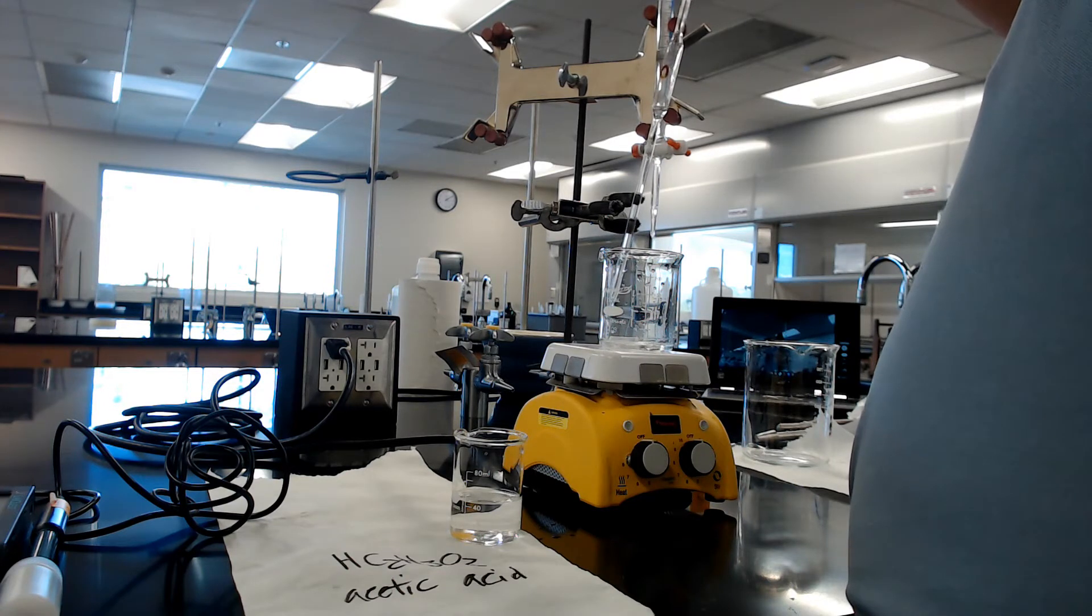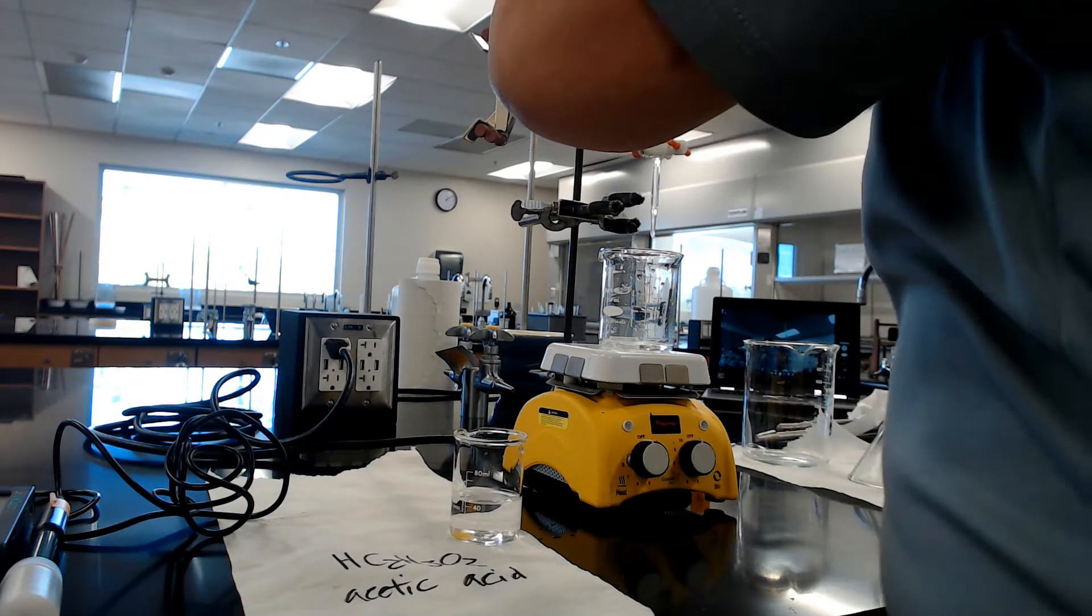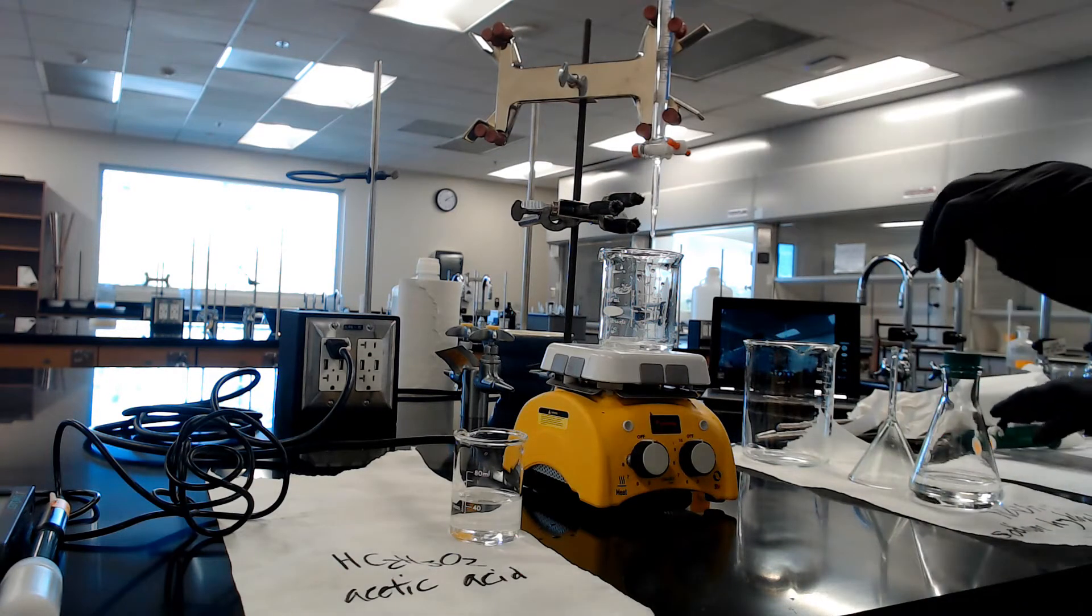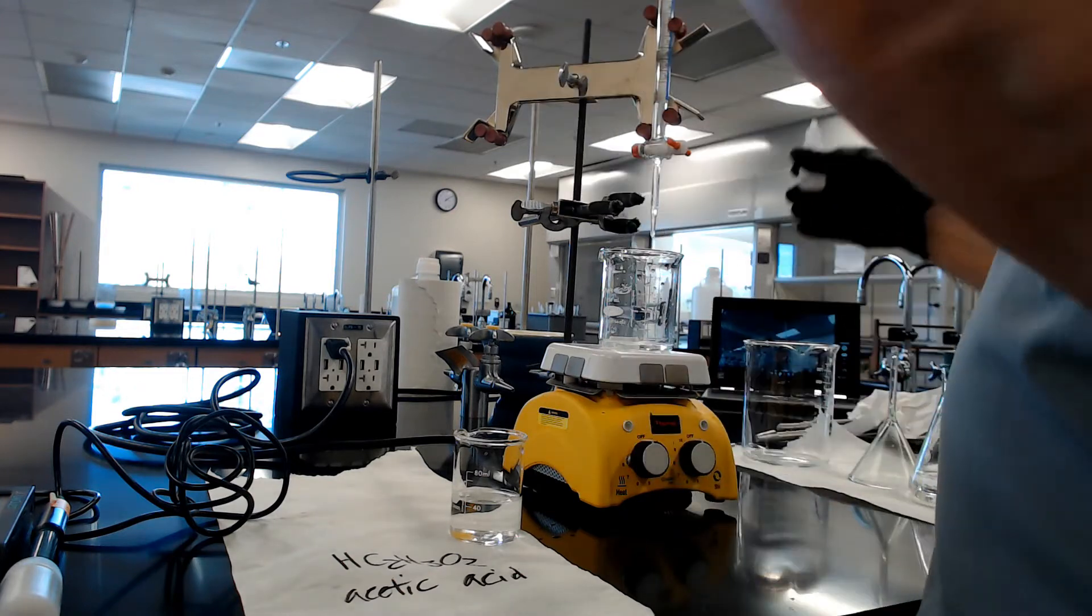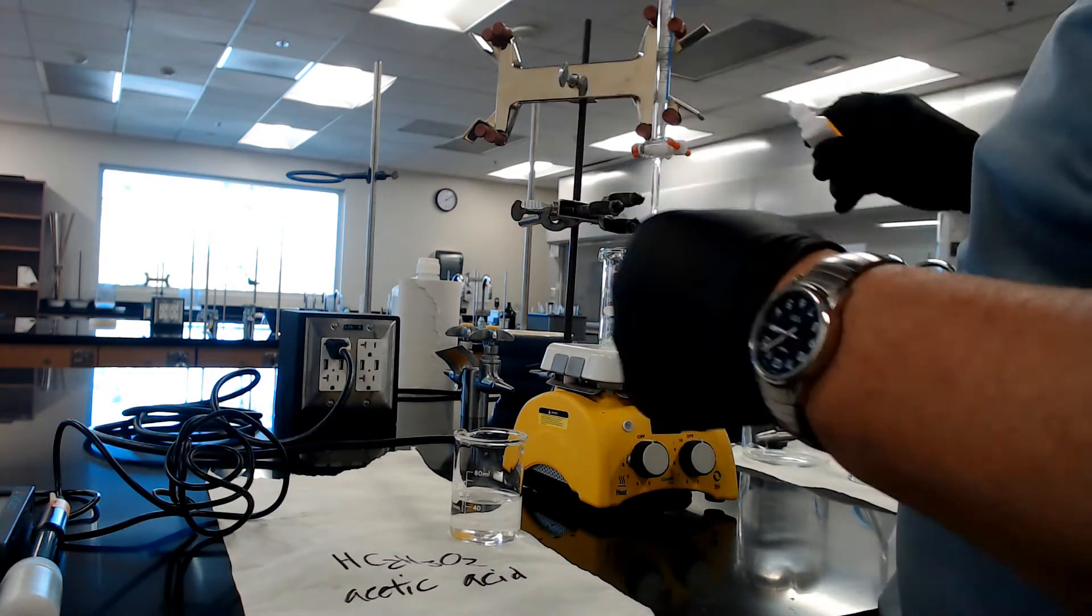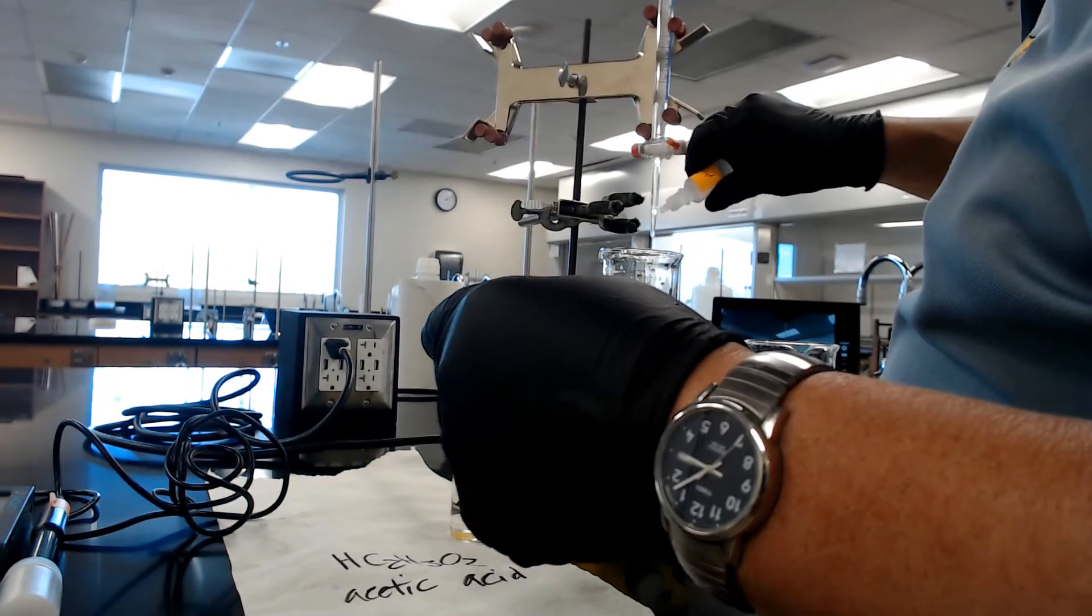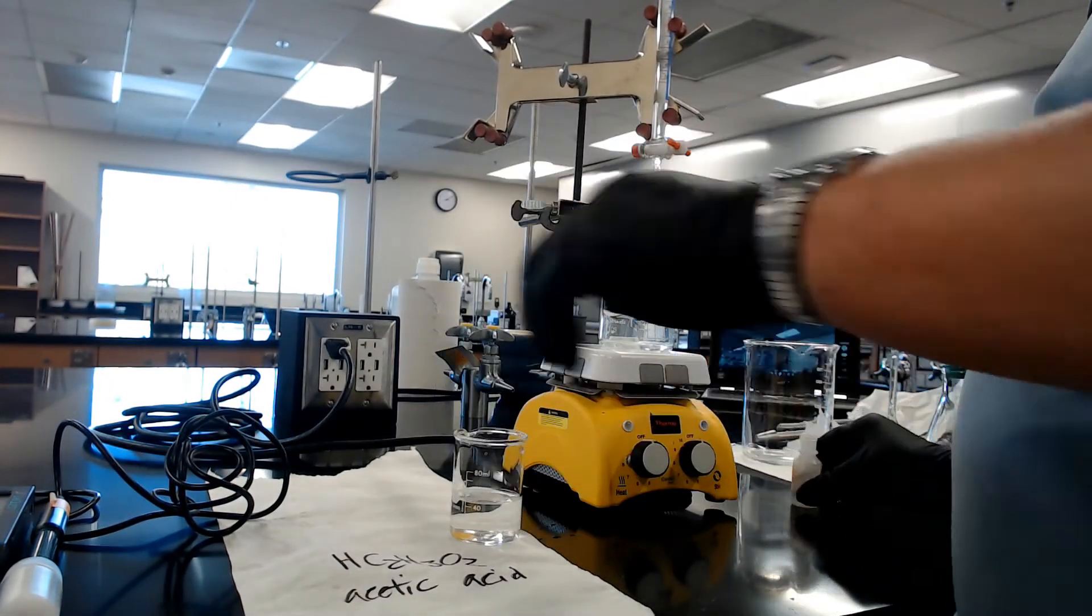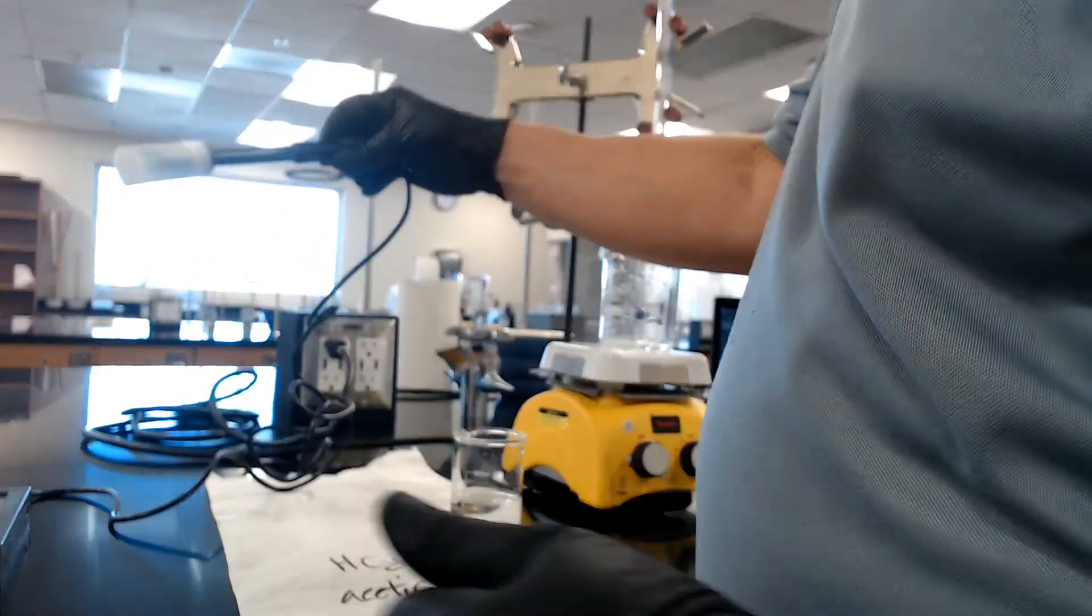I'm pushing the button, I'm dispensing. Got the last drop in there. Remember, put the indicator in there, but this time it's not supposed to change color. One, two, three, good.